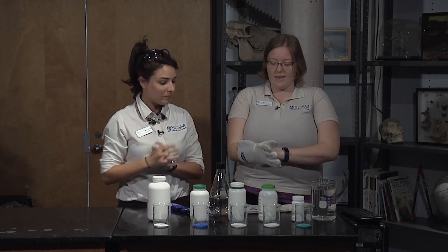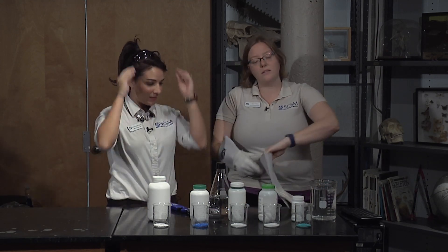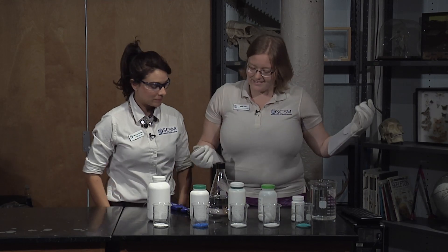So let's go ahead and get started. For safety reasons we're gonna be setting things on fire. So I do have my fire retardant gloves here. And I'm not using any because I'm not lighting the table on fire. Miss Laura is not using the lighter. I also have glasses on to protect myself from any splashes or anything like that. But I will be putting my goggles on. Excellent.